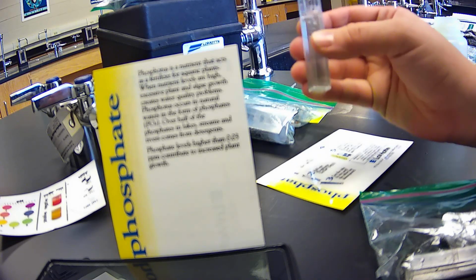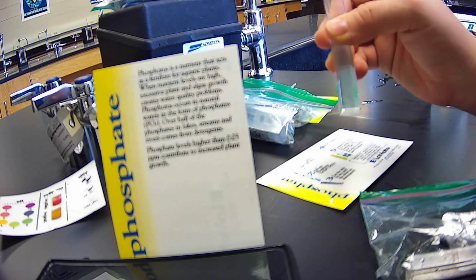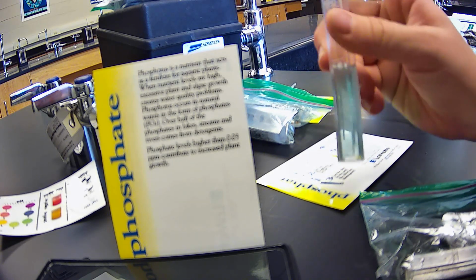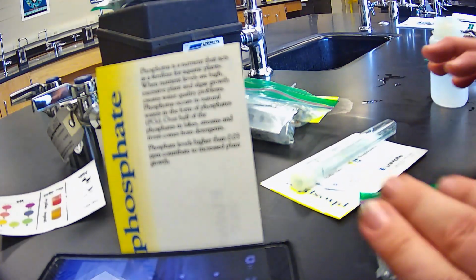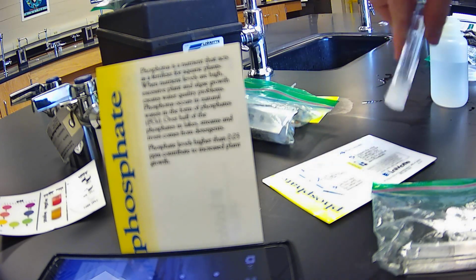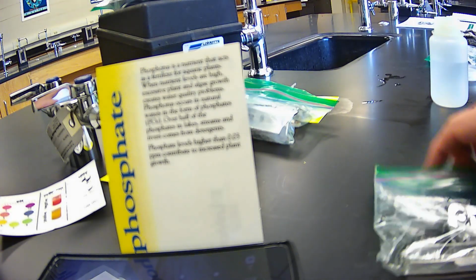All right. That is pretty disintegrated. And boom, disintegrated. All right, so we're going to wait 5 minutes on that one. Now if we come back to this, 5, 6, 7, 8, we have about 1 more minute left on our nitrate one.